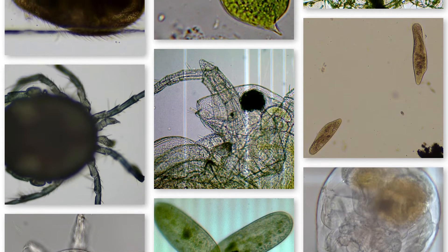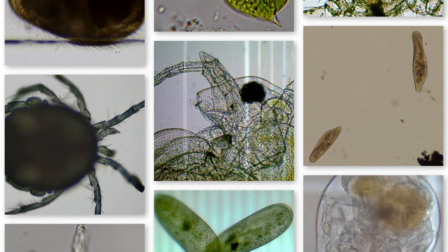Now I got to warn you, some of them look a little prickly and mean, but most are very safe for people and very natural components of a pond system. Many of these creatures actually filter out algae — they use algae as a food source and can filter out hundreds of thousands of cells every day. Some neat creatures we're going to cover today, so sit back, enjoy, and hope you learn a lot.